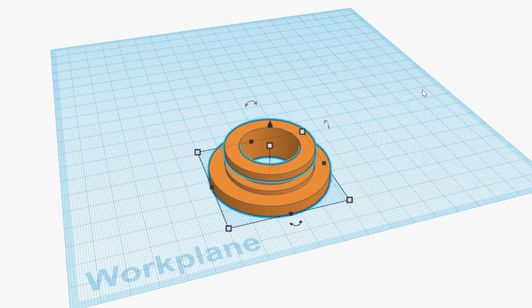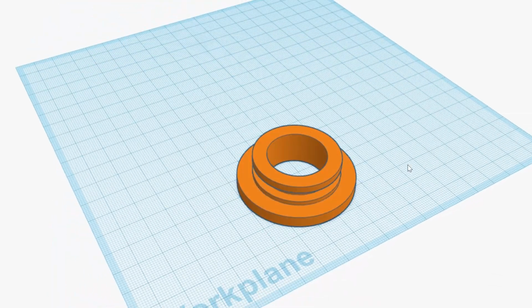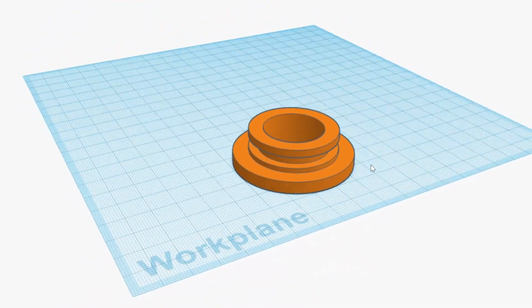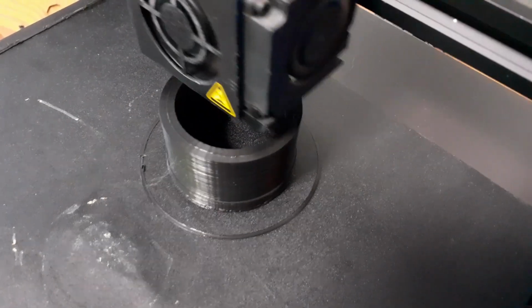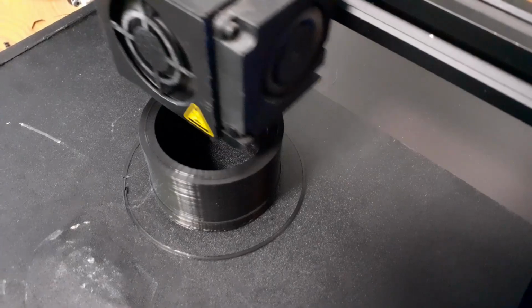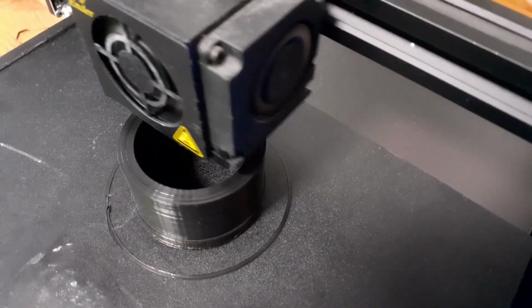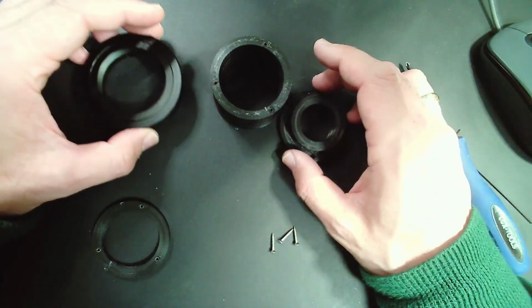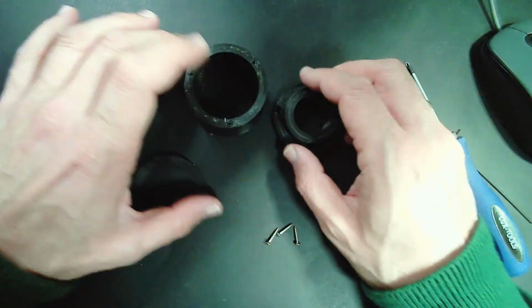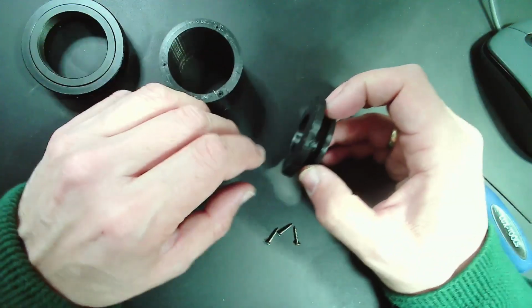This is now the bottom part of the DSLR adapter, which goes into the microscope. Then I started to 3D print it, and this took quite a long time, several hours, and I used 100% infill, so it's solid plastic. I just want to show you now the parts of the adapter. There are several parts here. I decided to 3D print the parts separately for easier printing.